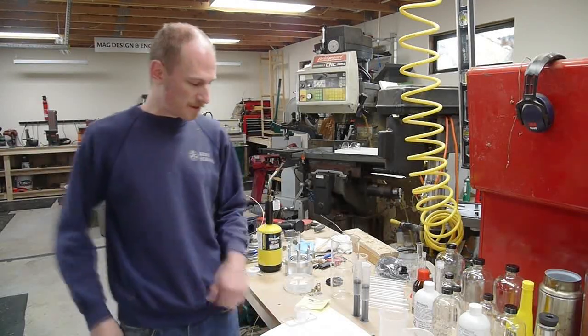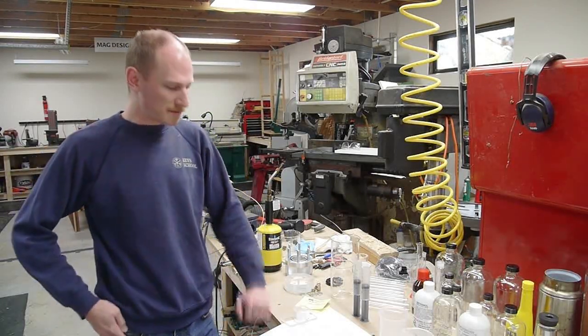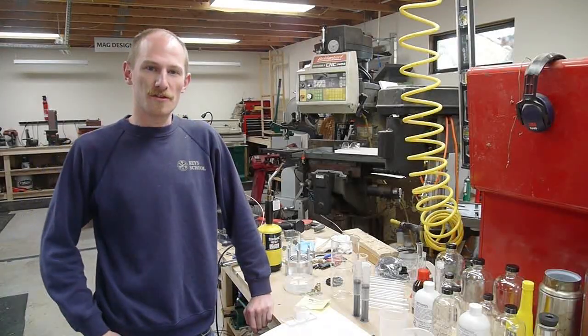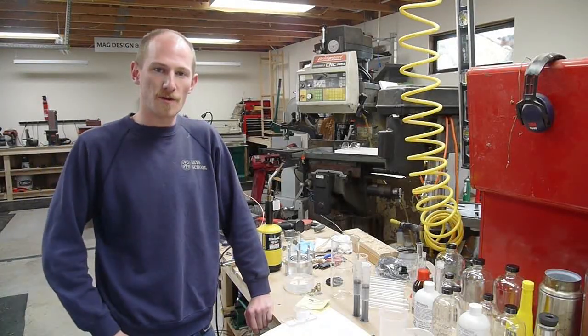Hey everyone, I finally finished my aerogel project and was able to make a few small pieces of aerogel in my home shop. So let me show you the pieces and then show you how I did it.